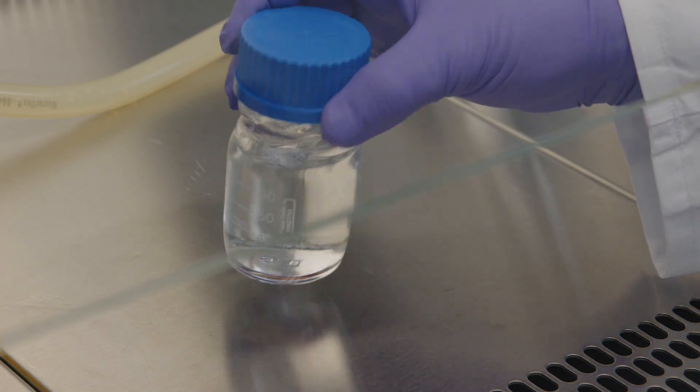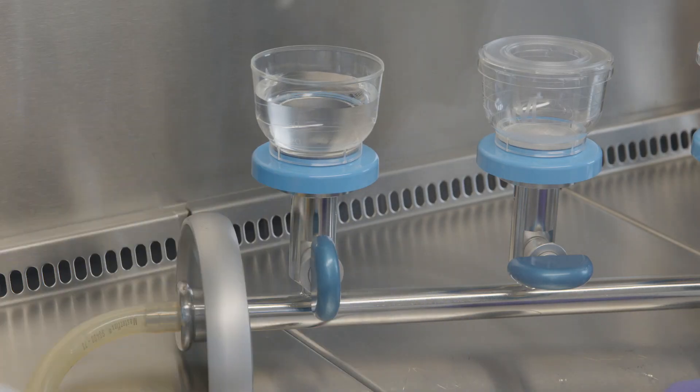Shake gently again. Filter the liquid through a membrane filter.